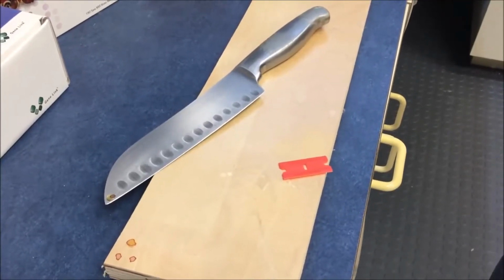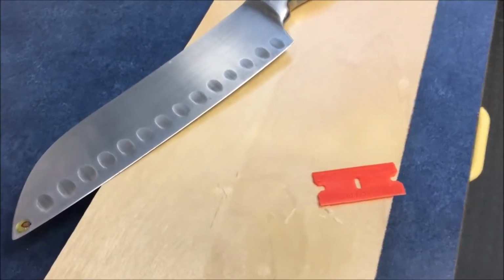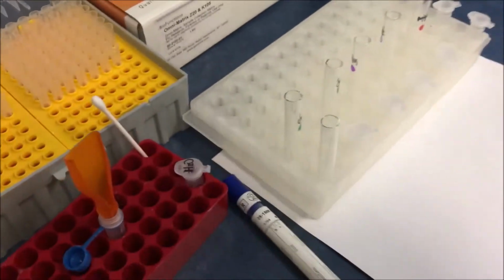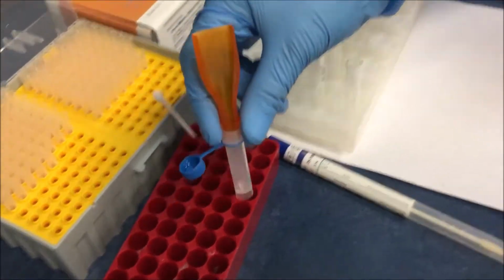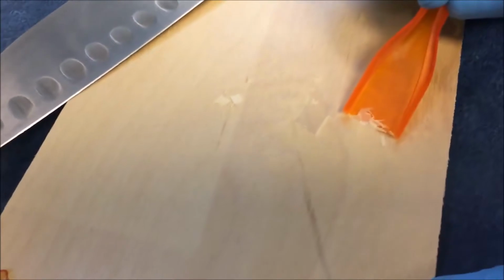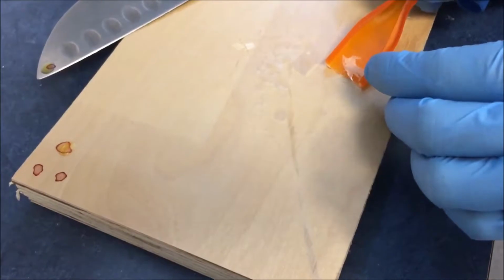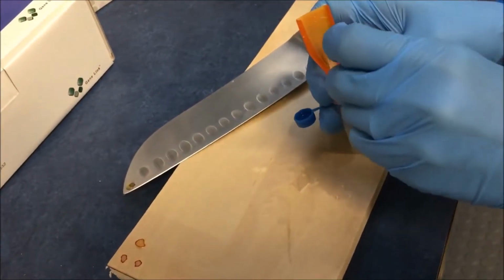We just showed you the collection of the dried Omni-Matrix using a scraper. Actually, this scraper is an intermediate step. We have designed a better system for collection, a special collection system connected to a tube, which is beta tested using 3D printers. This is a better collection system for the dried Omni-Matrix, where the collected Omni-Matrix can be directly collected into the collection tube.